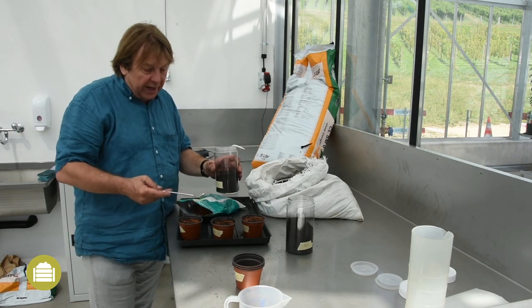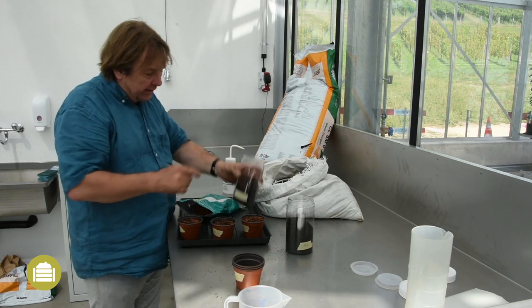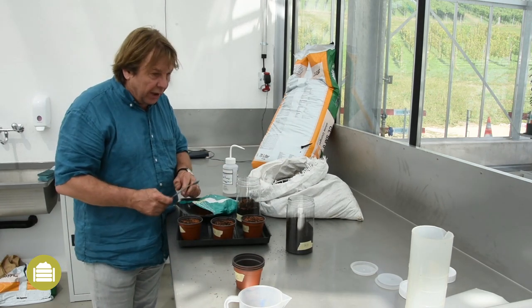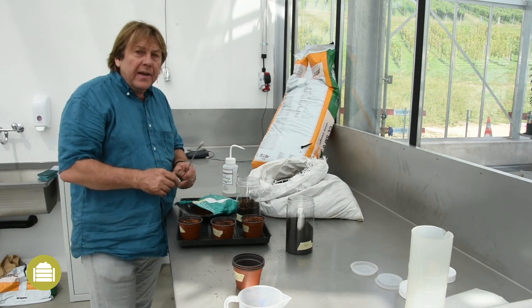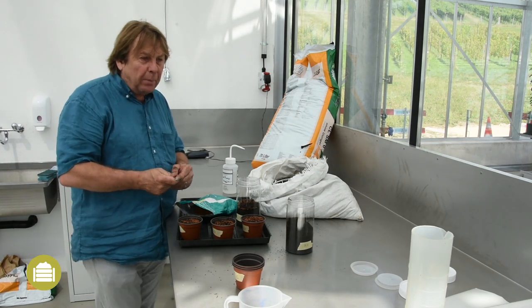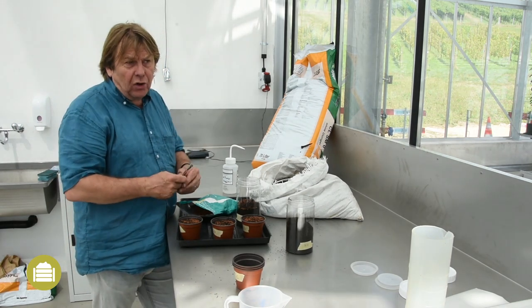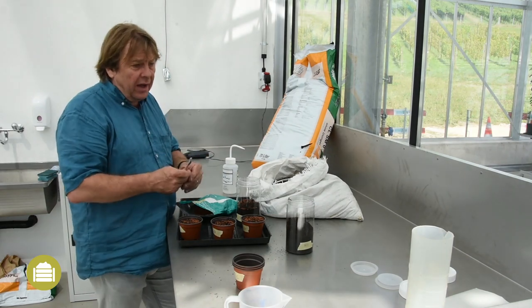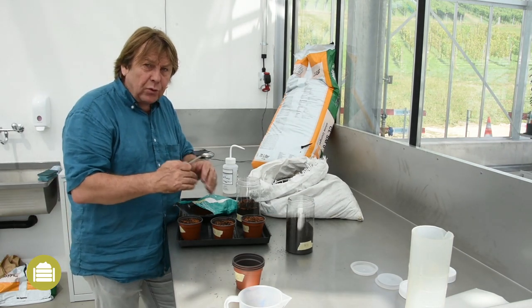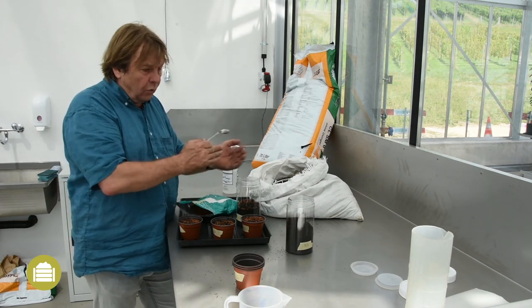In the open test I will measure the weight of the plants. In the closed test, the root length. The results are always in comparison with those of the reference substrate. This permits comparing results of tests conducted at different moments in the year — in summer or winter — even though the environmental conditions were not the same.